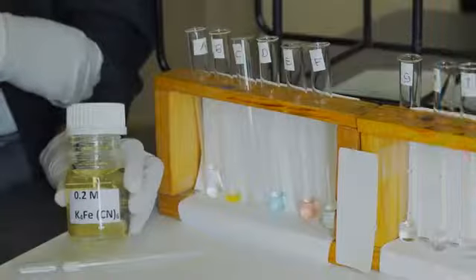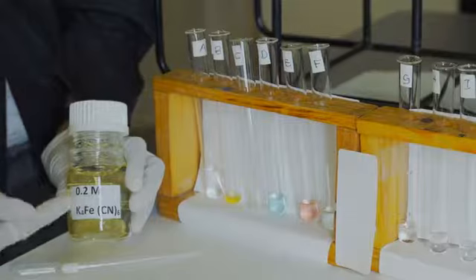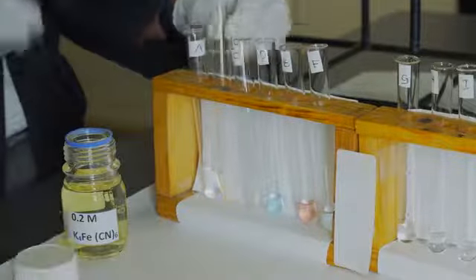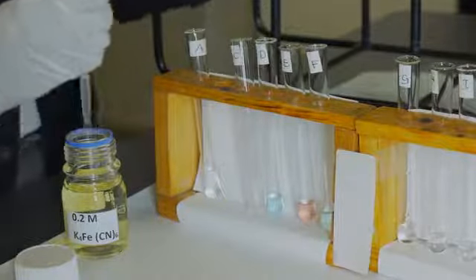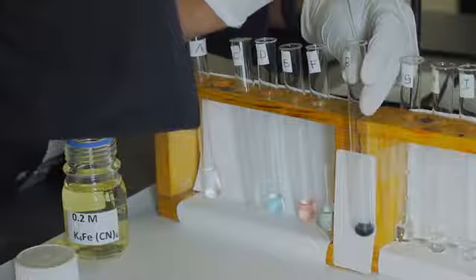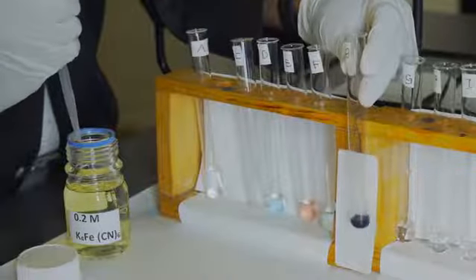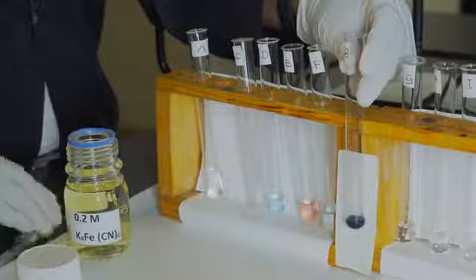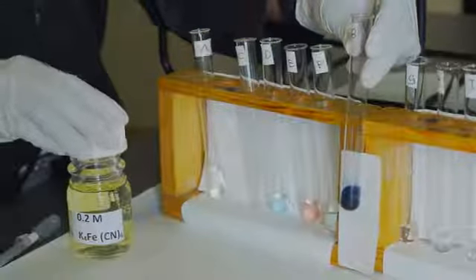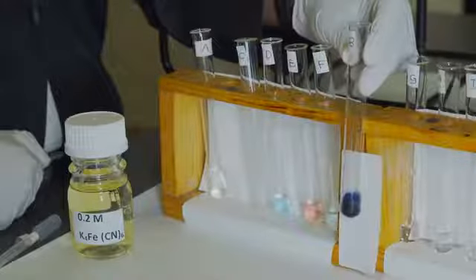To confirm the presence of Fe3+ cations, I will be adding three drops of a 0.2 molar potassium hexacyanoferrate(II) solution to 0.5 milliliter of the cation solution suspected to contain Fe3+. This should lead to the formation of Fe3+ hexacyanoferrate(II), which can be identified by an intense blue color. The observation of a blue color in our test tubes confirms that we do have Fe3+ cations in the solution.